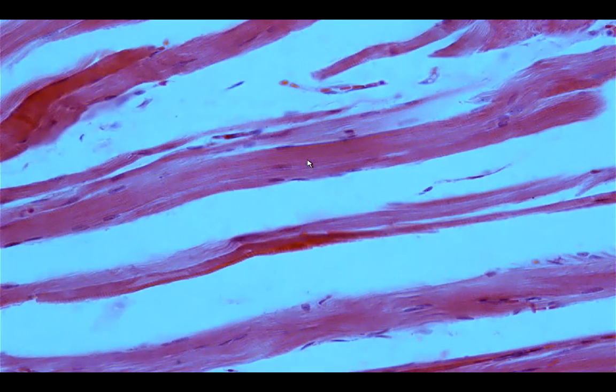The middle portion of the esophagus would be of a mixed type, wherein in the muscularis propria, you would see both the skeletal and the smooth. But on the lower region, you have the smooth muscle fibers. So again, you would be able to appreciate that this would be the skeletal muscle by the presence of the cross striations, as well as the presence of the peripherally located nuclei. Okay, so we are through with the skeletal muscle. We go with the cardiac muscle.